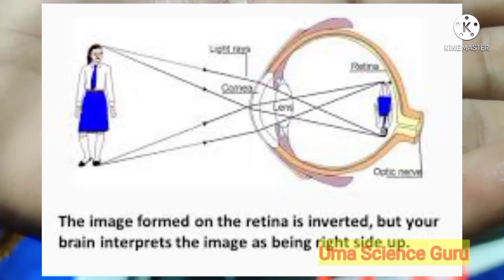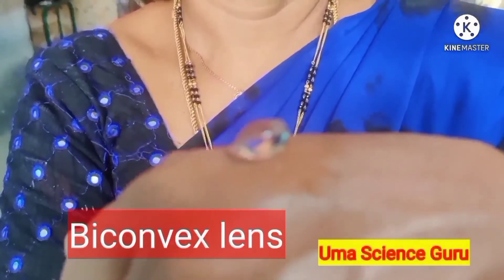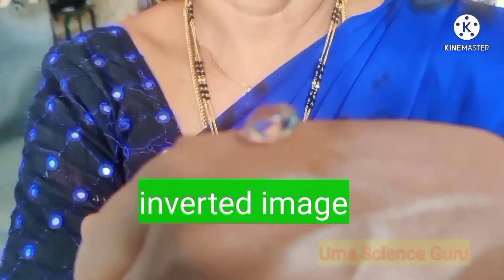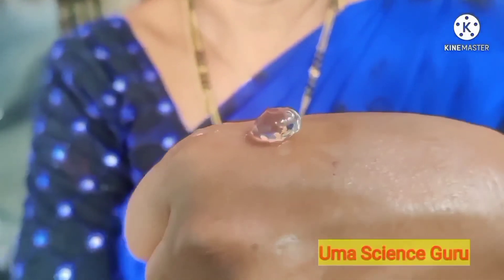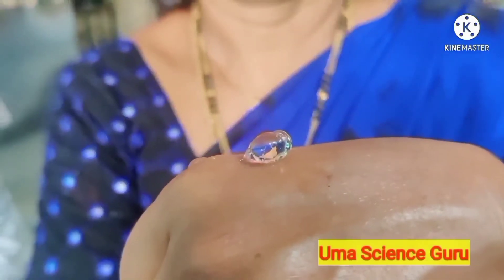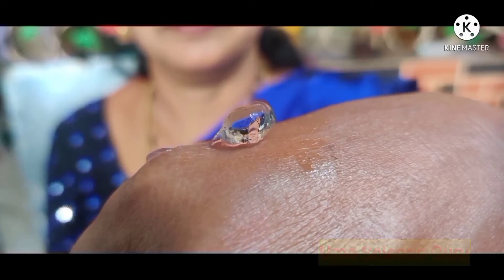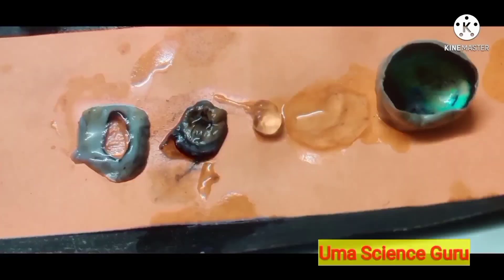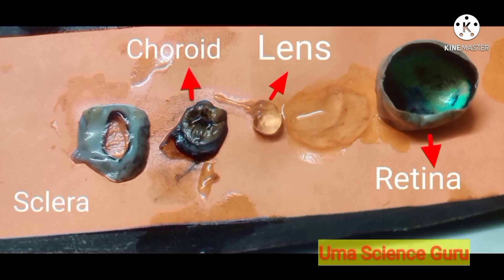The optic nerve carries messages from the retina to the brain. The brain analyzes the message and converts the upside-down image to an upright position and restores normal size. Students, observe through the biconvex lens of the eye — I am looking inverted through this lens. Thus the function of the eye lens is similar to a man-made optic lens. The eye lens is held in position by ciliary muscles; contraction and relaxation of these muscles changes the size and focusing of the lens, allowing us to see very far and very near objects clearly.